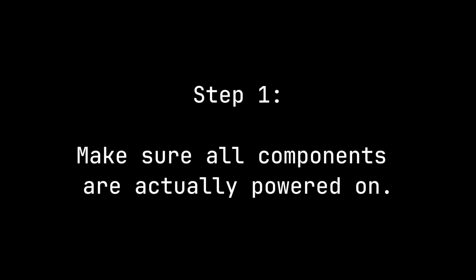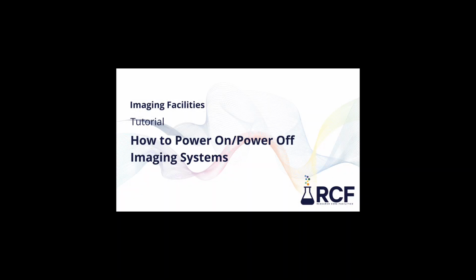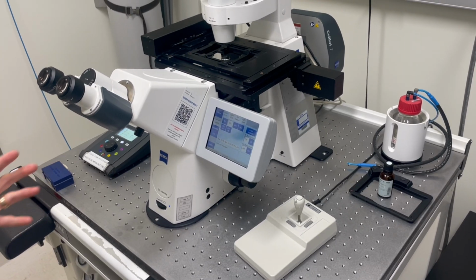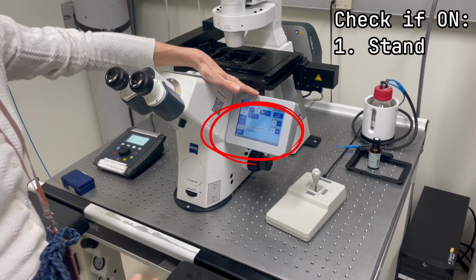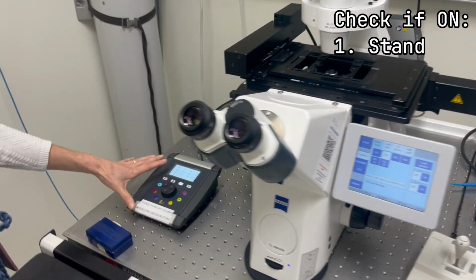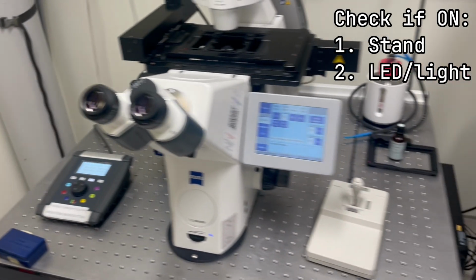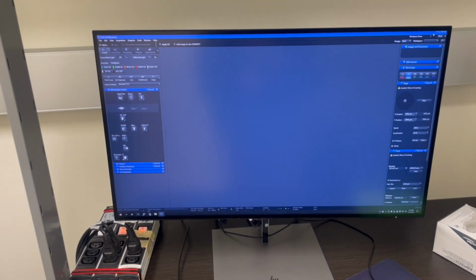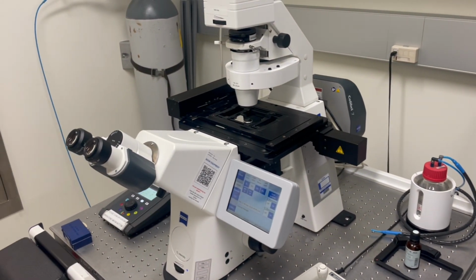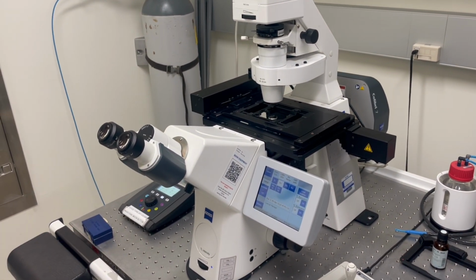Step 1. Make sure all your components are powered on. To ensure that you're doing this properly, you can check the powering on and off video. So for this particular microscope, we're looking at the stand, the light is on here, the LED source, and the computer and the software. There are other systems where you might have to check if the lasers are on as well.